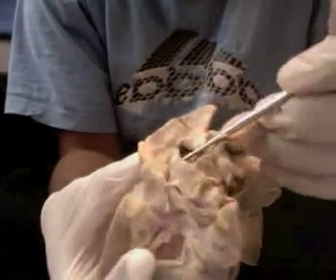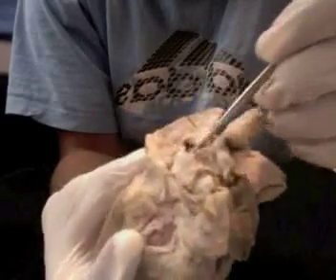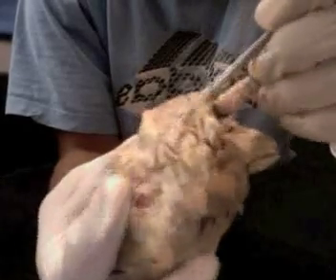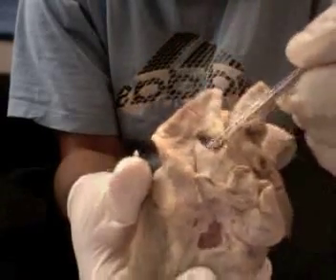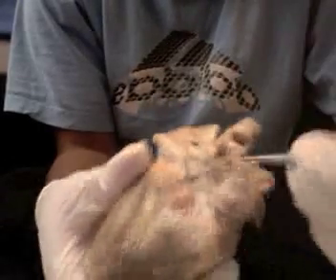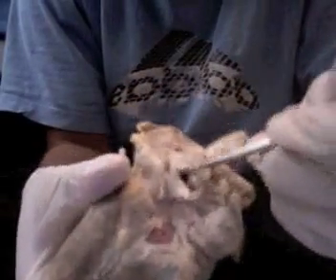For your veins, we do have your superior vena cava, which gets blood from the brachiocephalic vein, the coronary sinus, and your azygos vein as well. And this blood is going into your right atrium. And then we also have your inferior vena cava. Right, here's the inferior one. And that is also going into your right atrium.